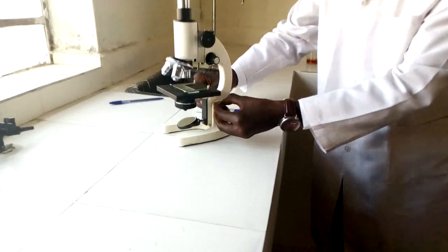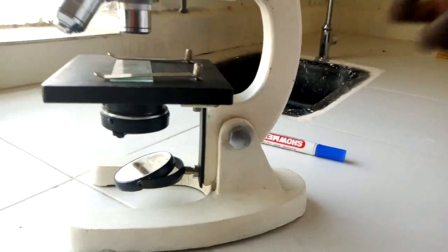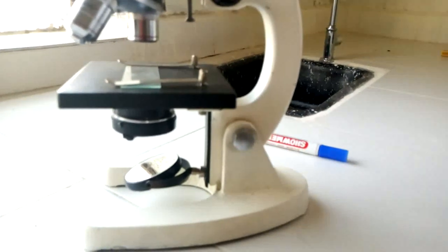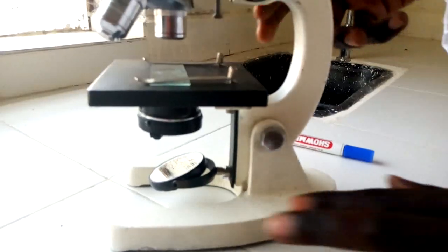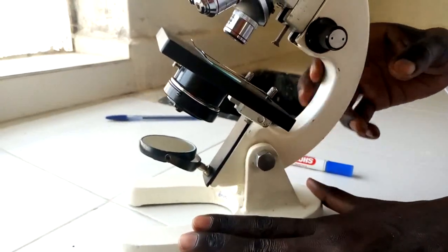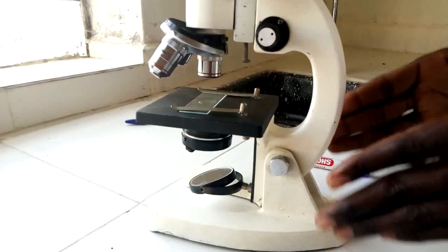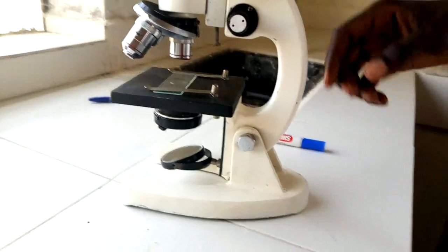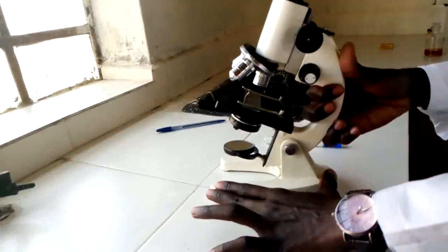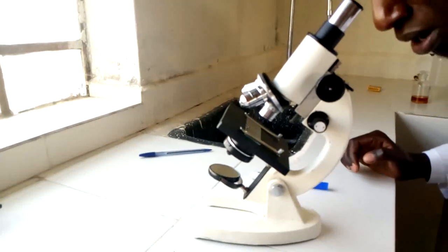The last part is referred to as the hinge screw. The hinge screw is present in some microscopes and absent in others. The function of the hinge screw is to enable tilting the angle at which the viewer looks through the eyepiece. It would be difficult to view a specimen when the microscope is straight, so by use of the hinge screw I can easily tilt the microscope and view comfortably.